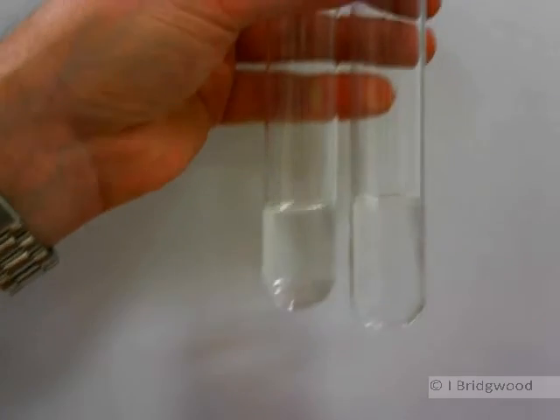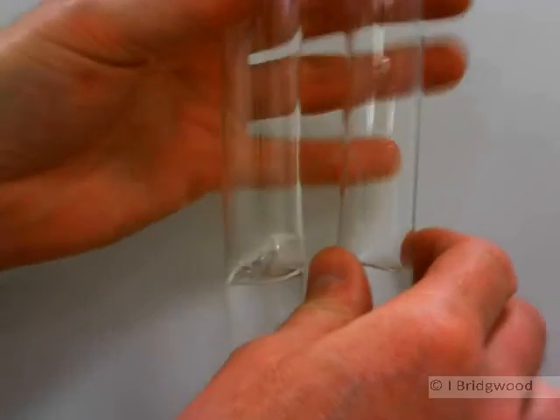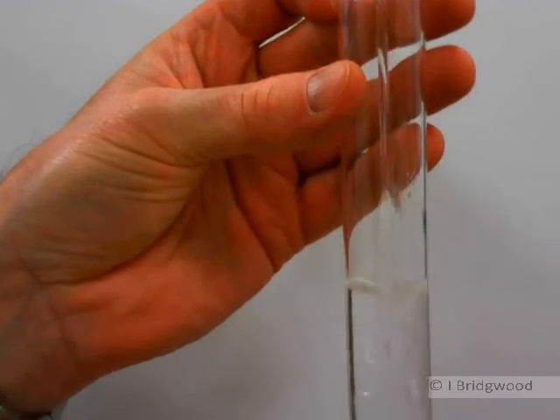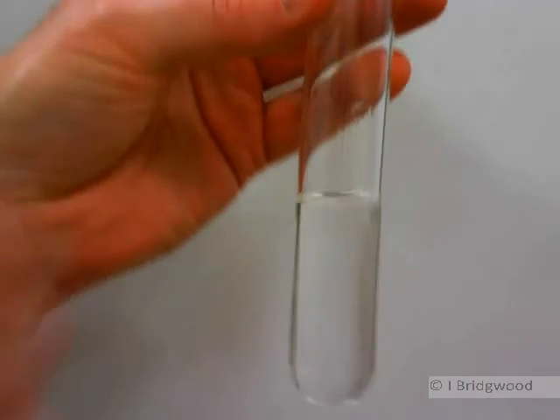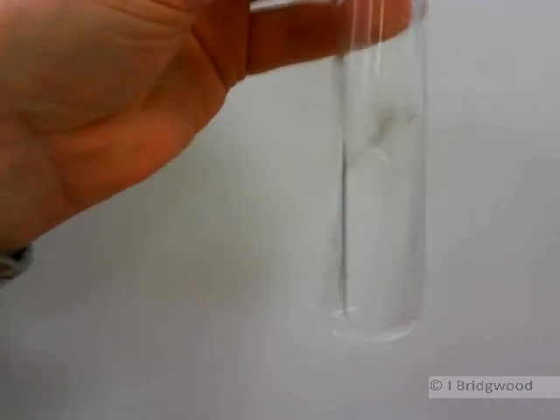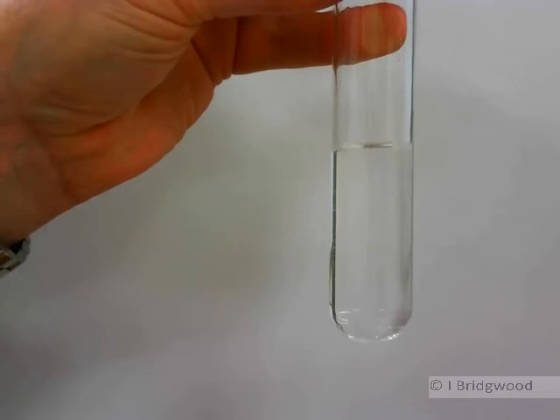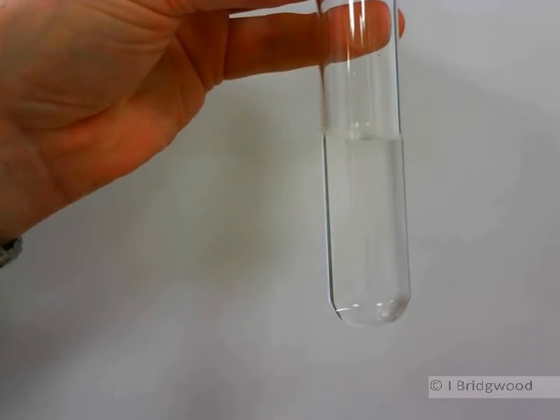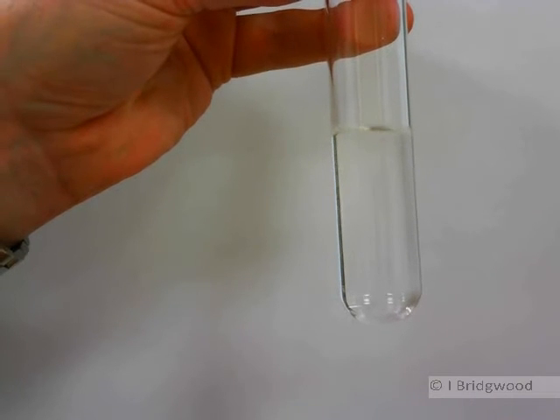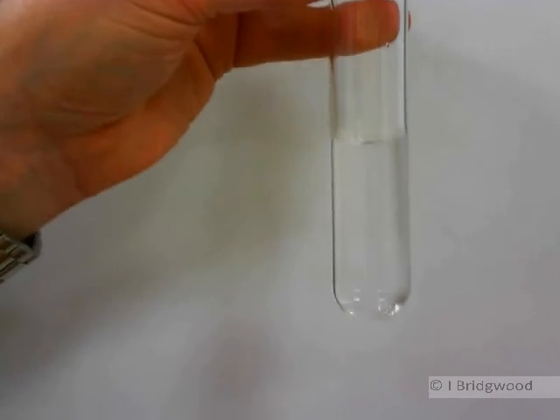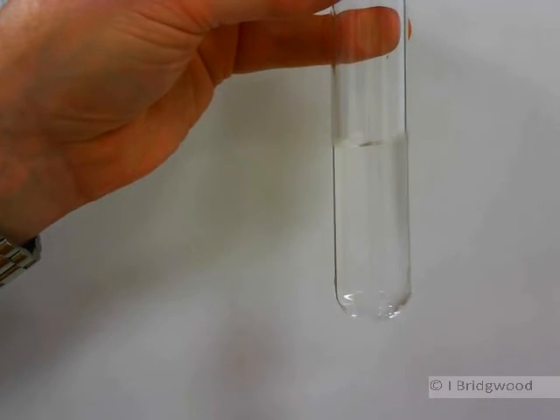Let's just mix the two together, shall we? Let's pour one into the other. There we go. And you can see that they are completely miscible. Completely mixing. Because moving the ethanol into water were breaking hydrogen bonds. And were forming new hydrogen bonds.